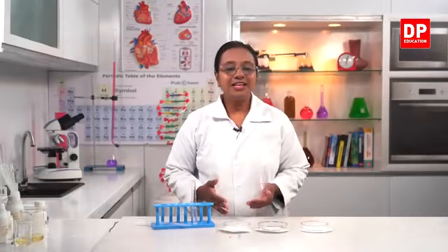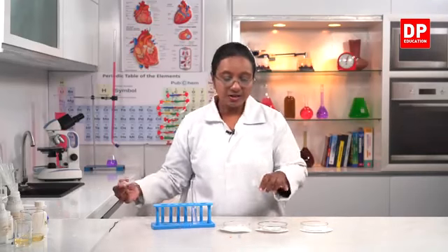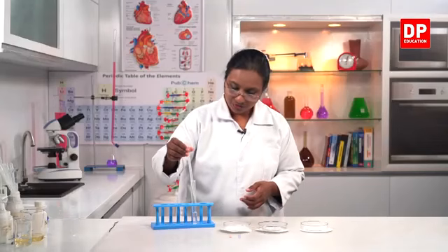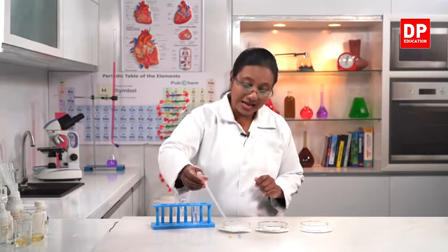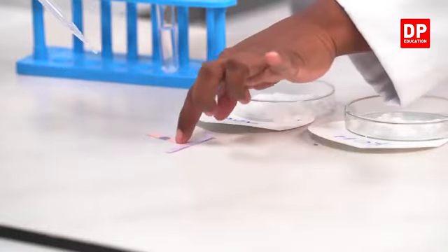So students, like identifying acids, we can use the litmus papers to identify bases as well. So here again, I have the blue litmus and the red litmus paper, and I have prepared a solution of sodium hydroxide. So it's an alkaline solution. Why? Because it dissolves well in water. And it is also a strong base. And students, since this is a tile, there's no problem. I can place the litmus paper on the tile, and on that I will put a few drops of sodium hydroxide.